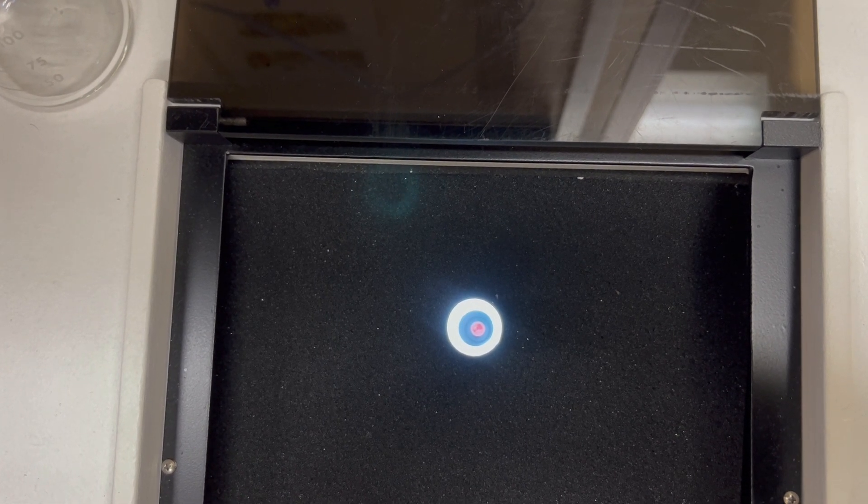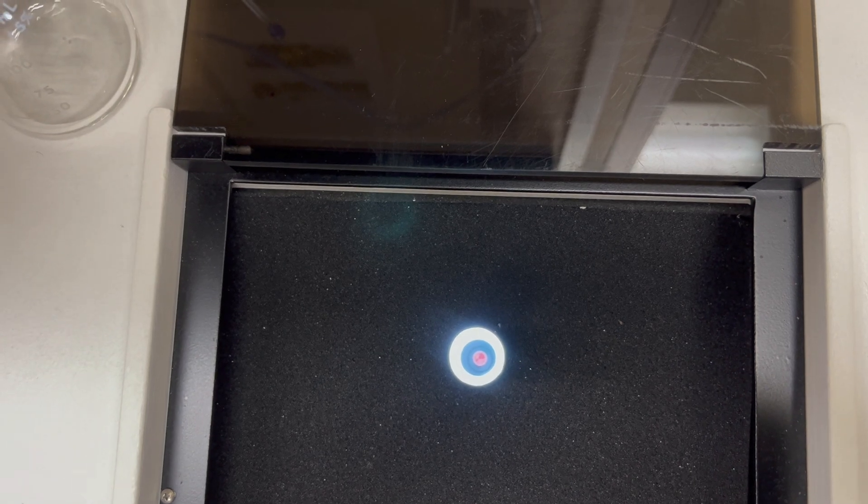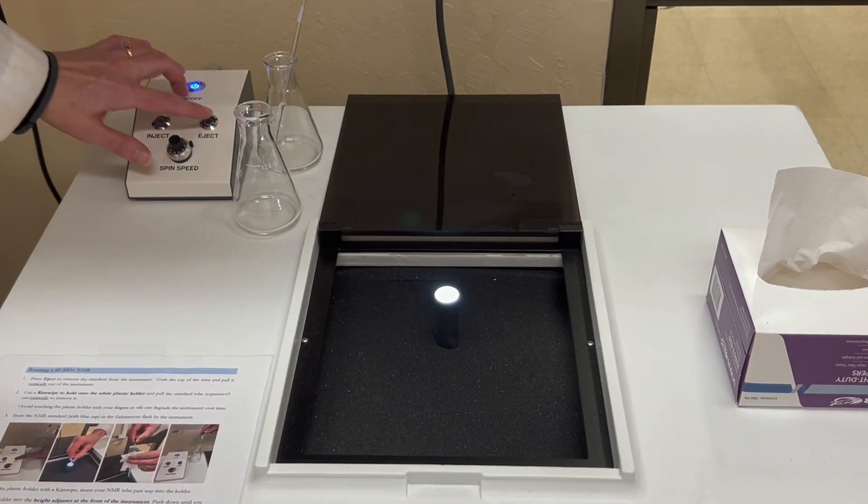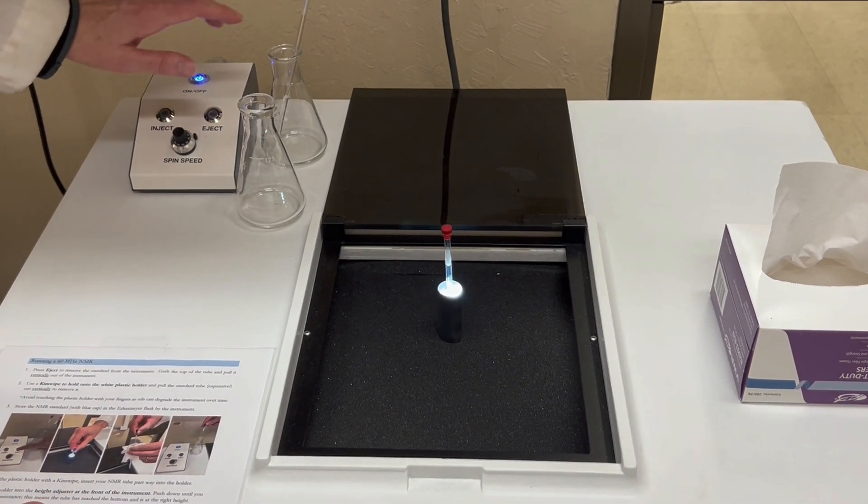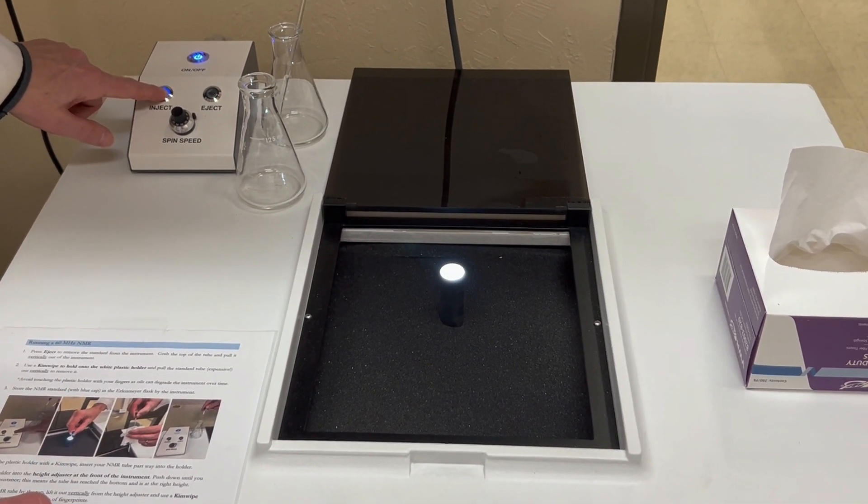If it does look like it's stationary and not spinning, all you have to do is eject it again and then inject it again. Just hold on the inject button for like two seconds and that normally works.